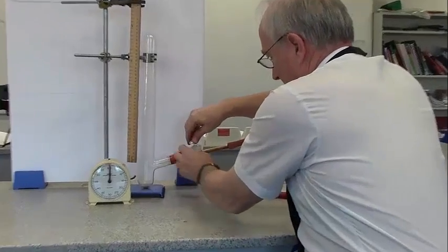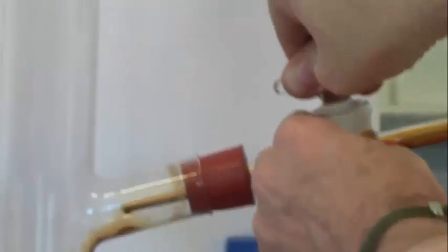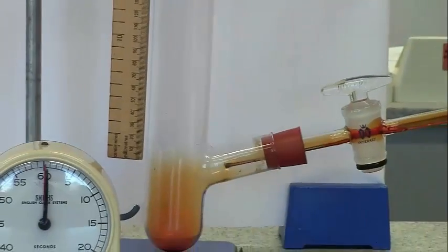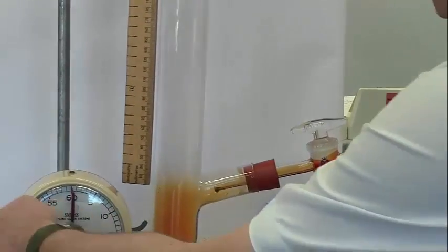There's the bromine. I will open the valve. And the bromine rolls in, and we'll start at that height. You can see the bromine's got to there. That's the bottom of the ruler, and we'll start the clock.